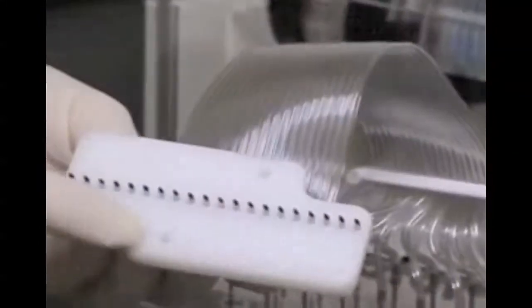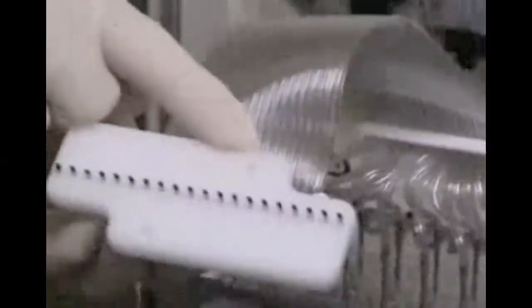The needle array is held within a white plastic block. This block also features two holes for alignment with the two pins on the focusing chamber.